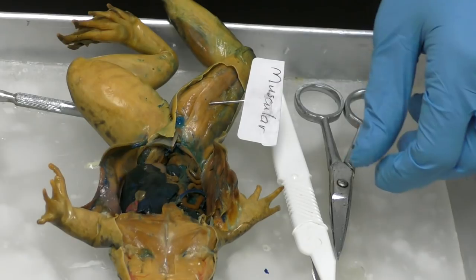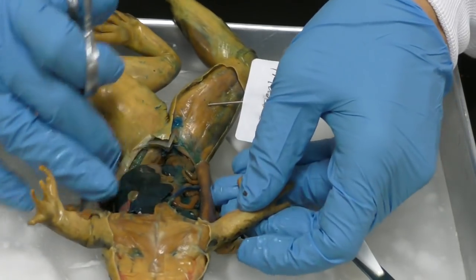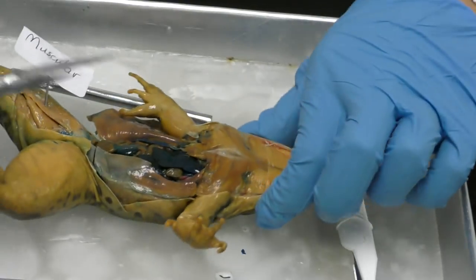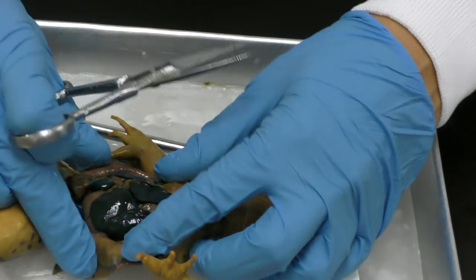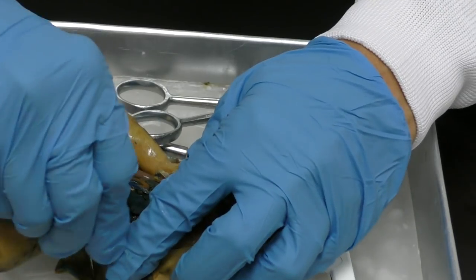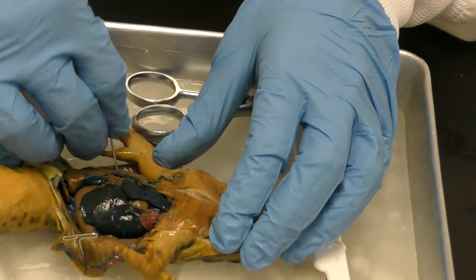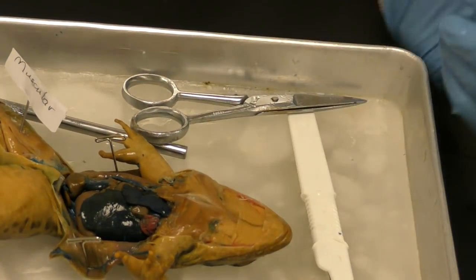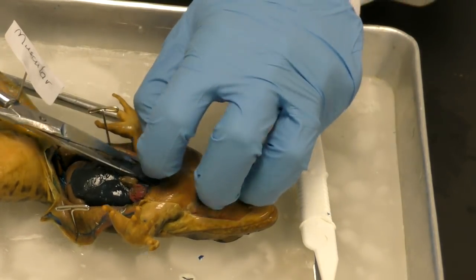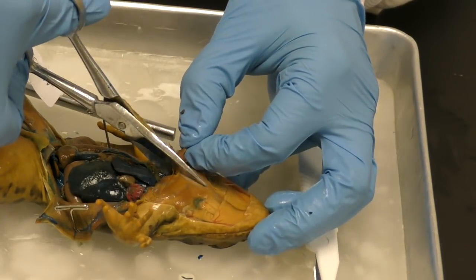Okay, the next thing that I'm gonna do is continue to cut through. So one option for me is I wanna make it so that you can see it the best way possible. Okay, one option for me is to pin back that muscular layer, because like I said, I already cut off the integument system for most of it. Okay, so that keeps it in place, and then try to listen. I'm gonna sever something, another system.